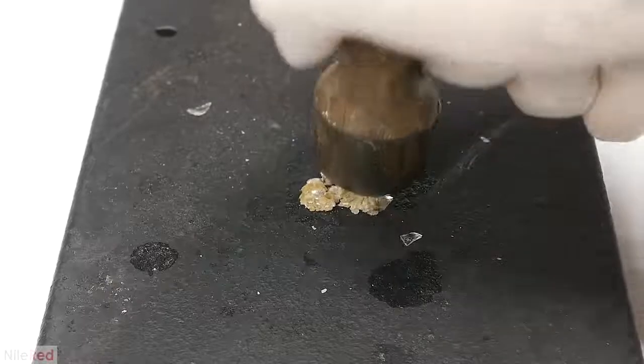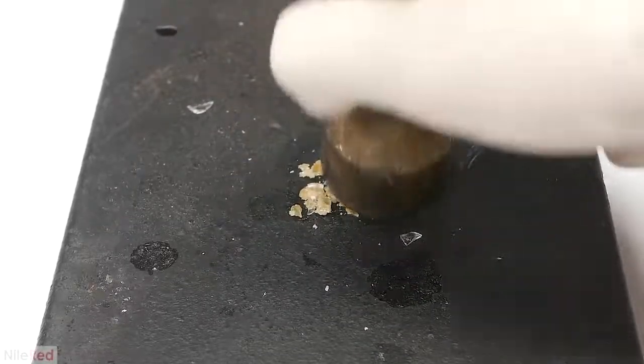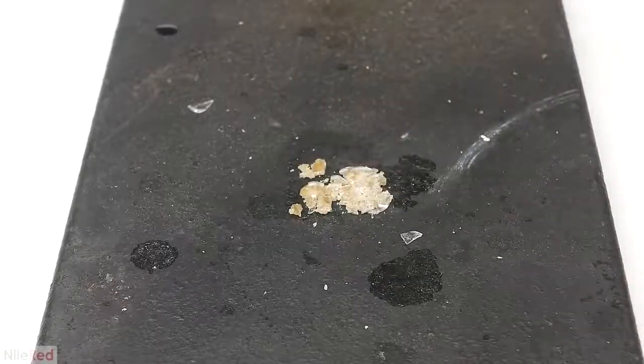These two runs didn't exactly give me the highest quality cellulose acetate, but they did highlight how important the plasticizer is. With not enough, we get a plastic that's too brittle, and with too much, we get one that's soft and not very durable.